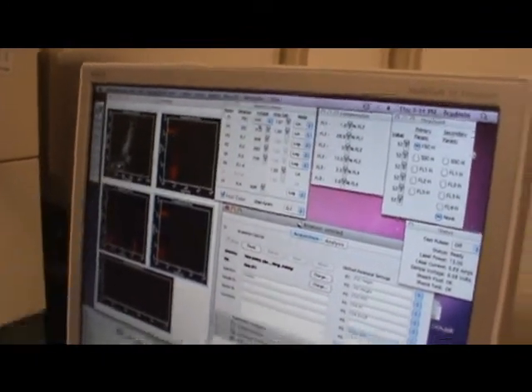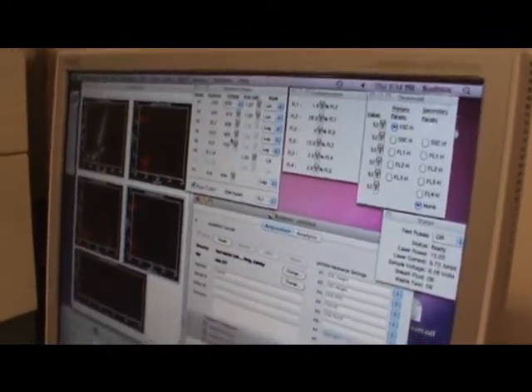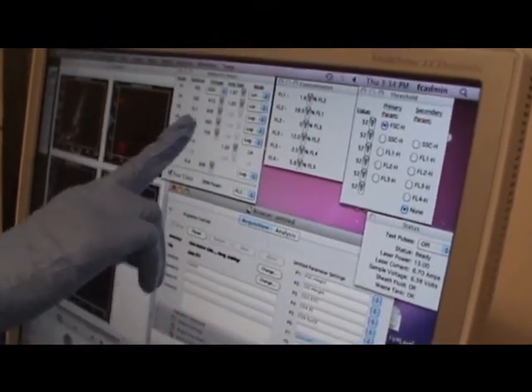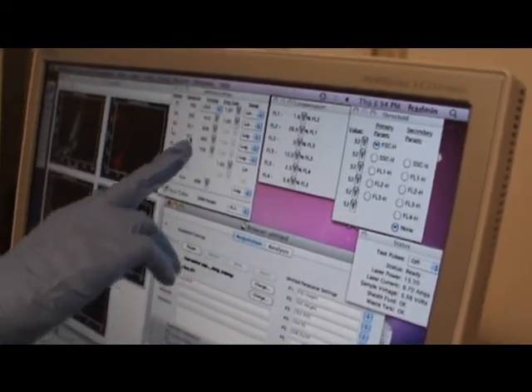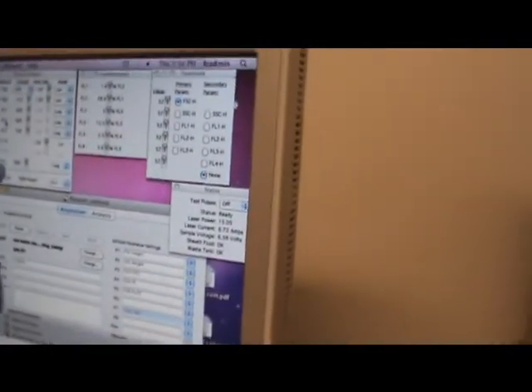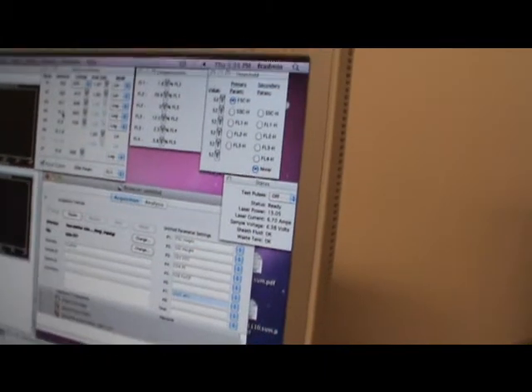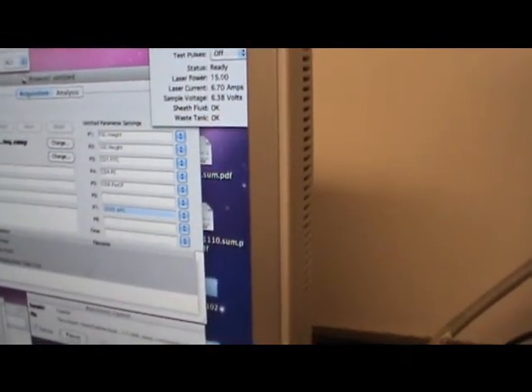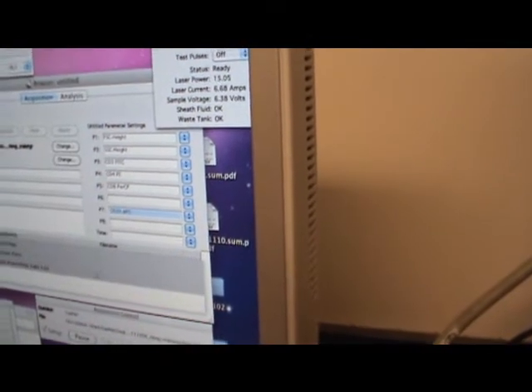So now, if I change this, this is PE, which is my FL2, right? PE is FL2, because FL1 is always FITC. FL2 is always PE. FL3 is always PerCP. And then FL4 is always APC. So FL1, FITC, FL2, PE, FL3, PerCP, FL4, APC.